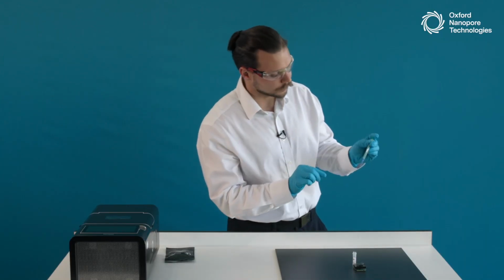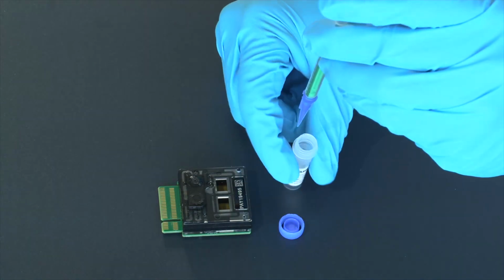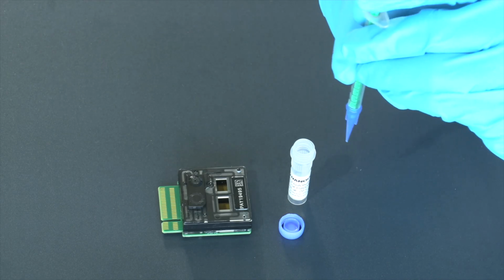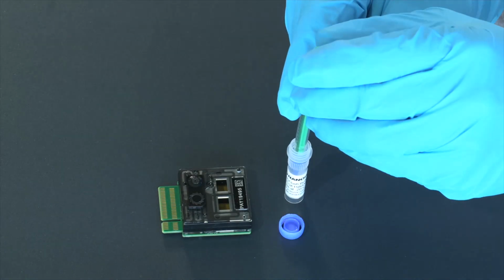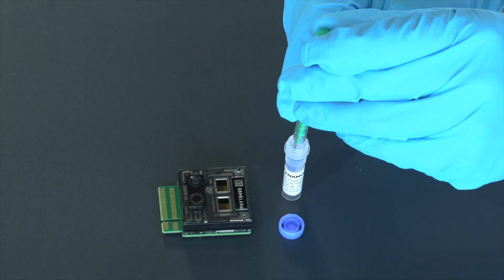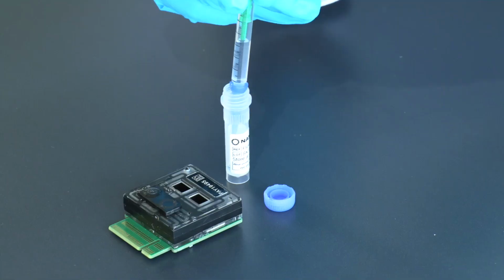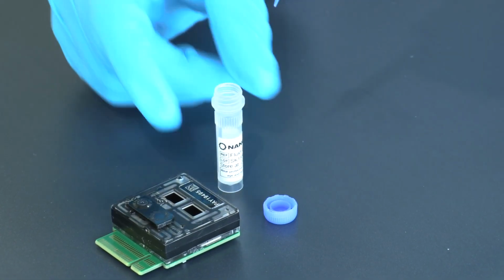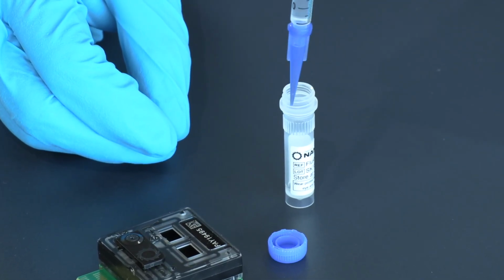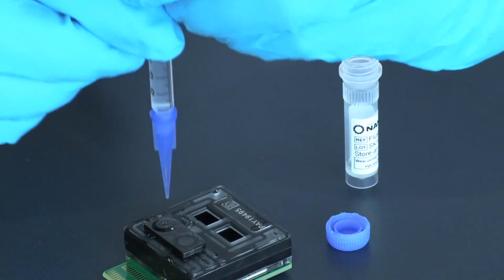So what I will do is I will take my syringe, insert it once again into the tube with liquid. I will make sure, of course, that the plunger is pressed down all the way to the bottom. So we insert it down and carefully aspirate the liquid up until the point where the widest part of the plunger reaches 0.5 mark on the syringe. I'll take out the syringe, check for any air in the pipette tip. I don't see any air in mine, so I know I can proceed with the second step of loading.